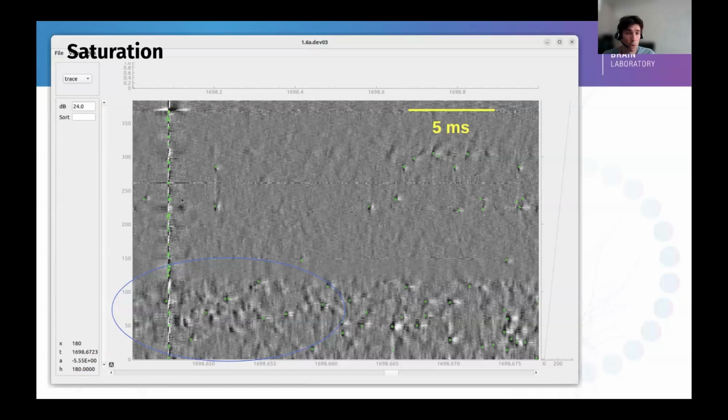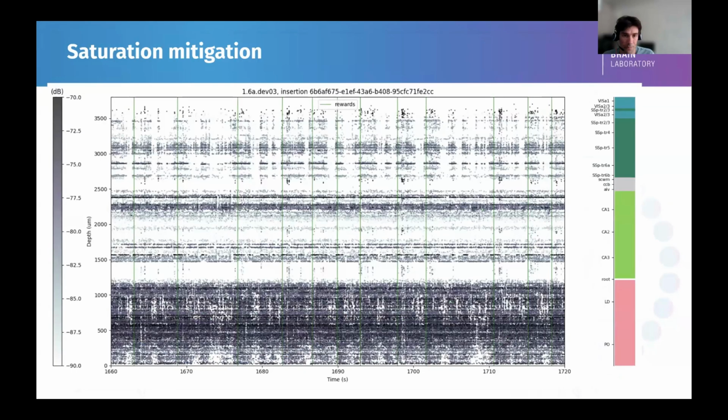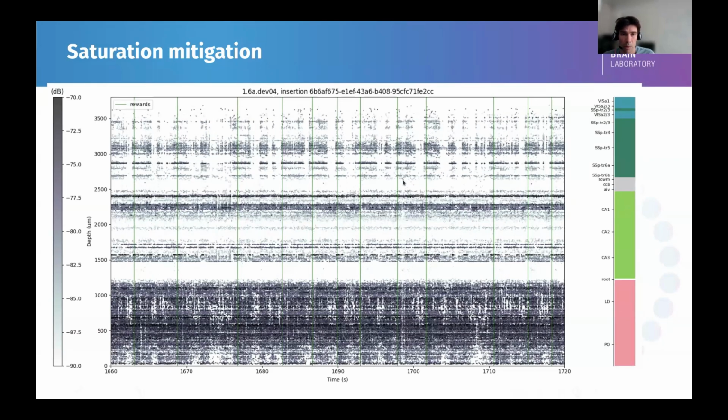I'm going to show that if we mute this saturation, you can recover more spikes in the signal band. After the mute, you can see that some green dots are appearing. So not only is there an impact of detecting bad spikes, it prevents the detection of the good spikes. So this is to be taken out as well. A way is to mute those samples after the pre-processing, so you can at least spike sort this and recover what is next. This is the raster plot corresponding to this recording, where those are task events in green, and you can see the spurious events there with spike detection. With this mitigation of the saturation, you can see that the spike sorting has way fewer wrong events detected.